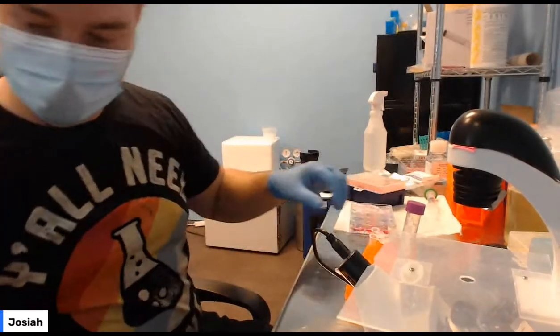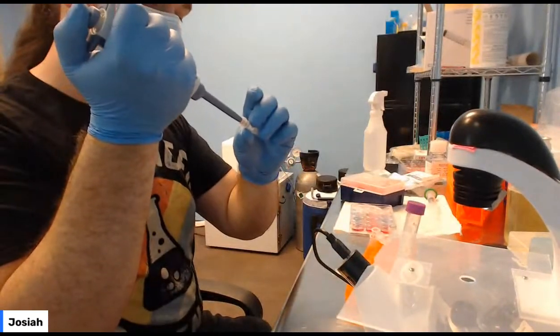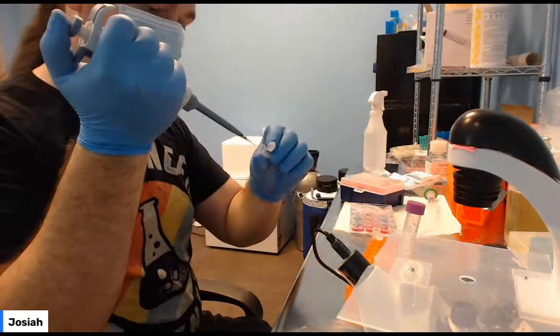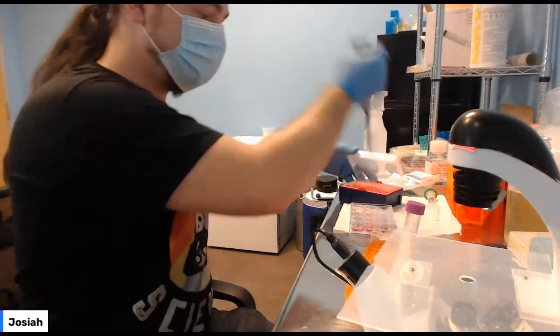We're going to add 3 microliters to each one.